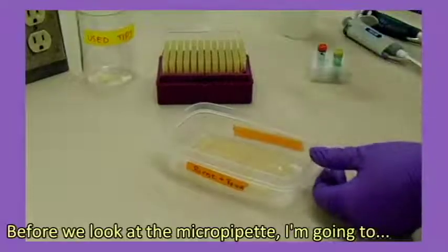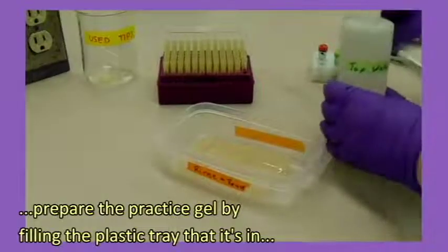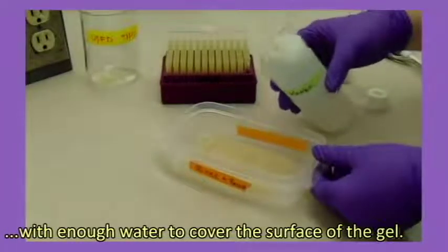Before we look at the micropipette, I'm going to prepare the practice gel by filling the plastic tray that it's in with enough water to cover the surface of the gel.